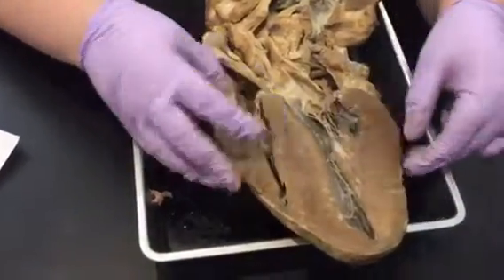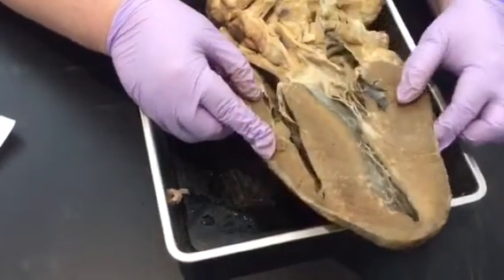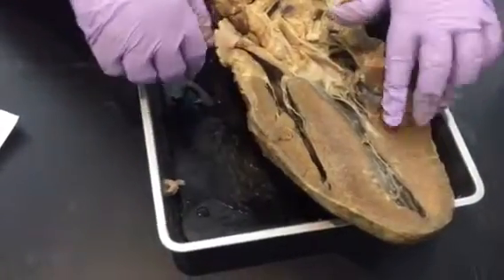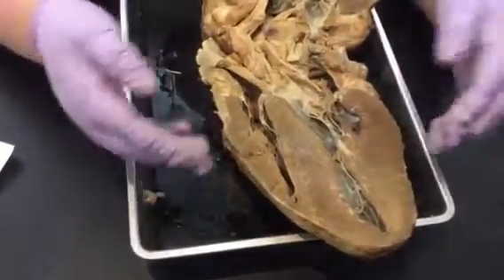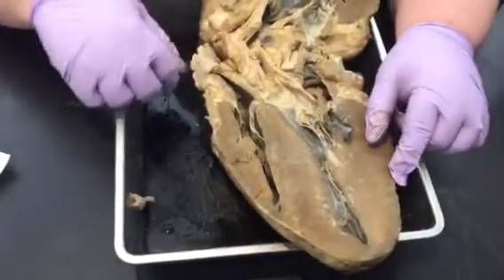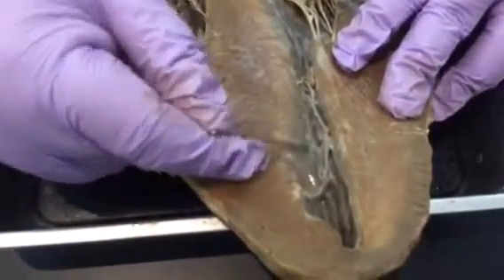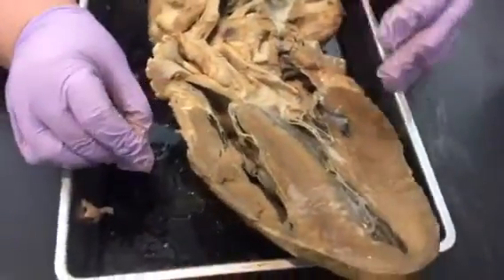Other structures you need to know: there is the epicardium, which is the shiny layer on the outside. An important one is the myocardium — all this really thick muscle. Myo for muscle, so these are the really thick muscles. At the bottom of the ventricles you'll see this crisscross muscle — that's the trabeculae carneae. Trabeculae means crisscross, carneae means meat, so it's the crisscross muscle.